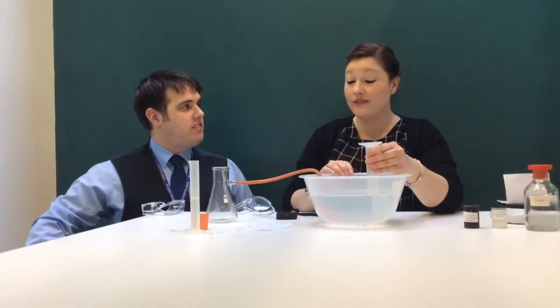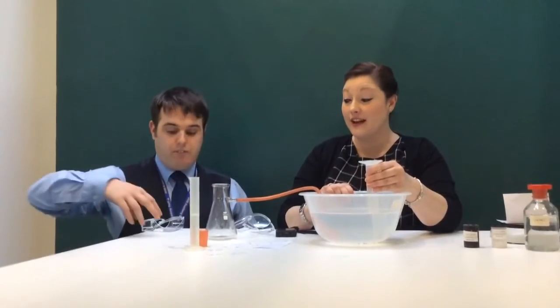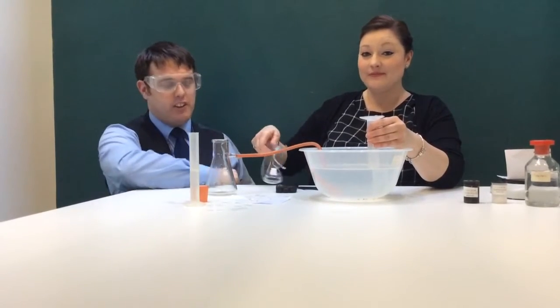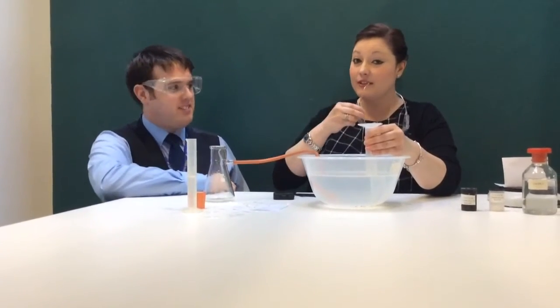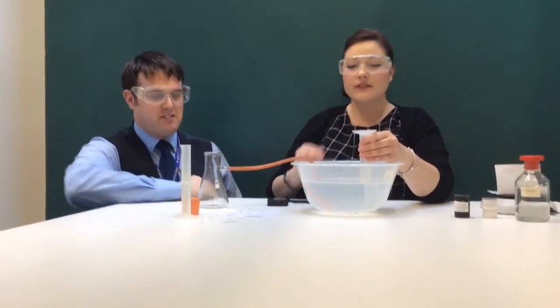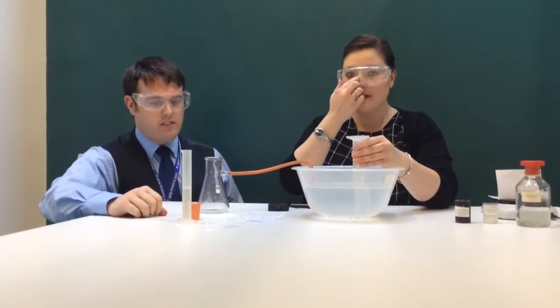Mr. Guest, I think we're forgetting something. We're using acid today. What do we need to do? We need to make sure we glasses up, guys. Safety first, as always. Thanks. So, we're about to start our reaction.